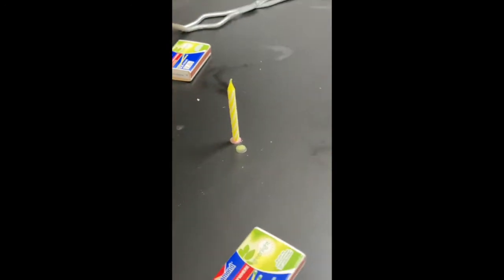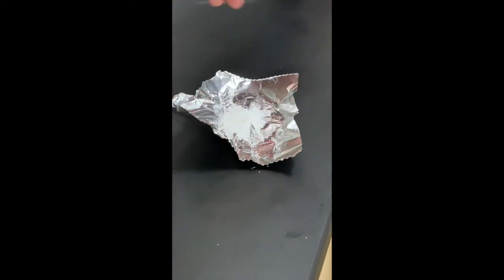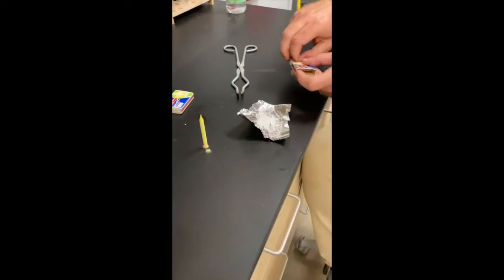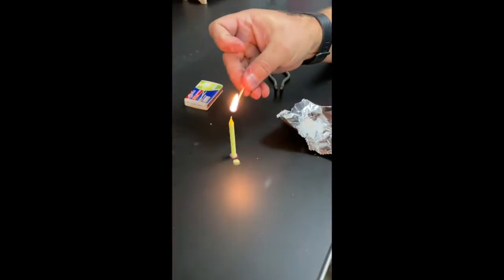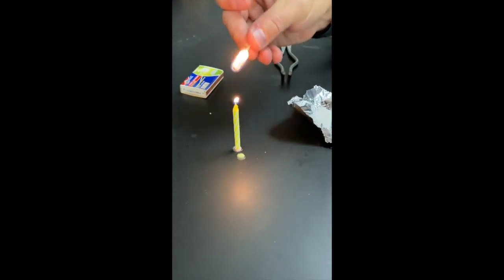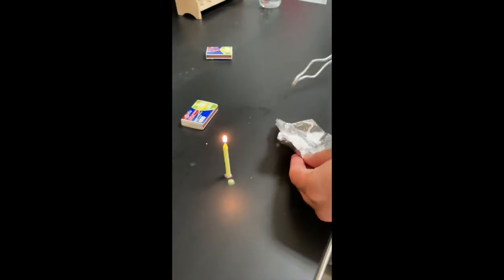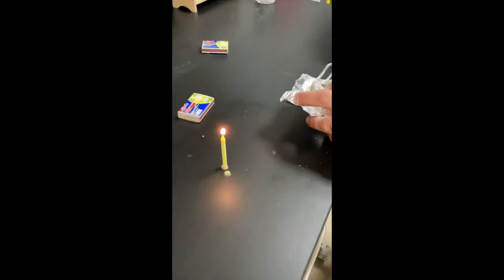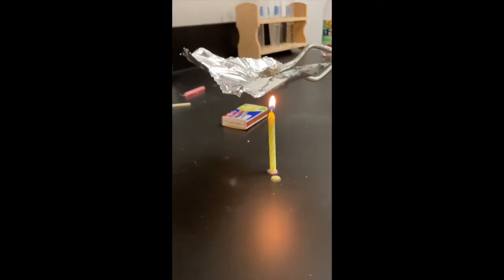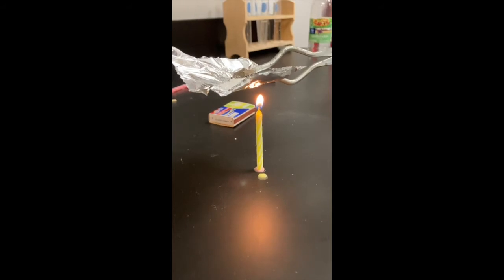All right, so now this third one is we're going to heat sucrose. So here we have table sugar, and that's what sucrose is, and I'm going to hold it with these tongs over the flame, and we're going to try to cook this sugar in the candle. We're going to take the sugar, and it gets pretty hot, so I'm going to leave it in the tongs. But then we just want to see the sugar, and you're going to start seeing things happening.